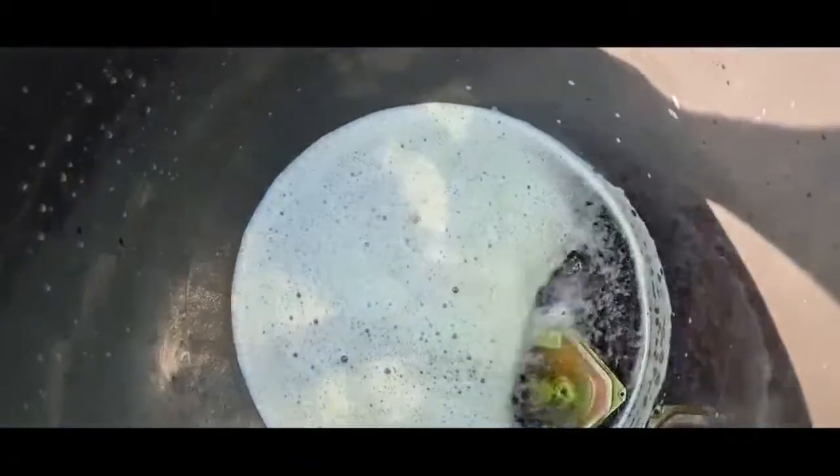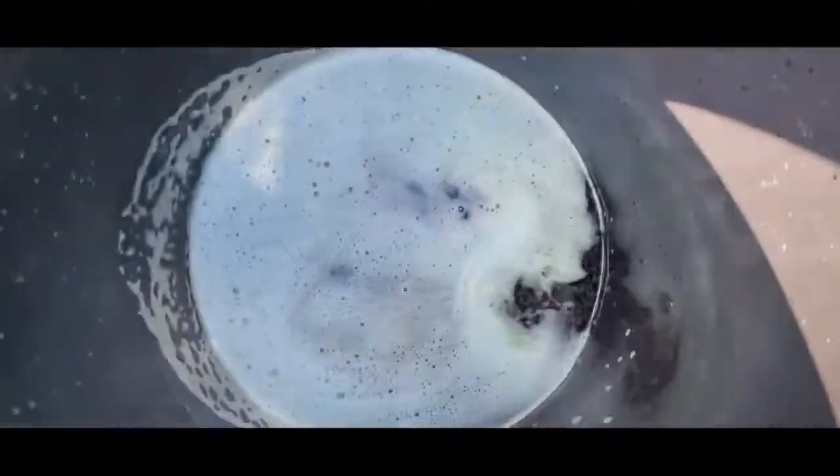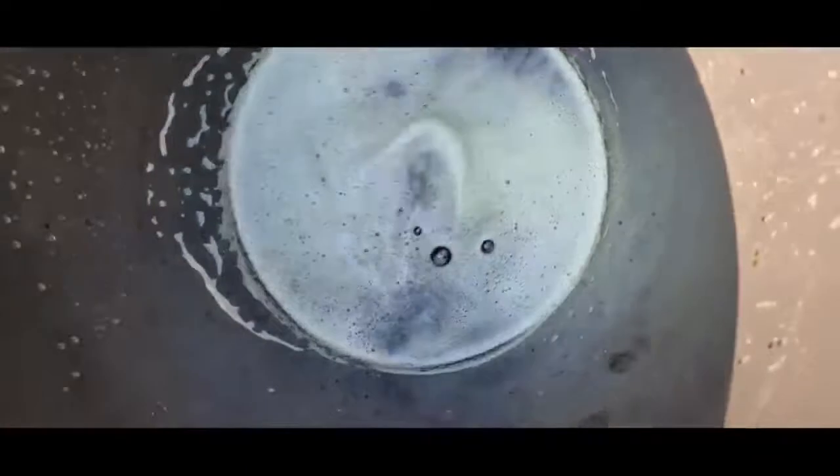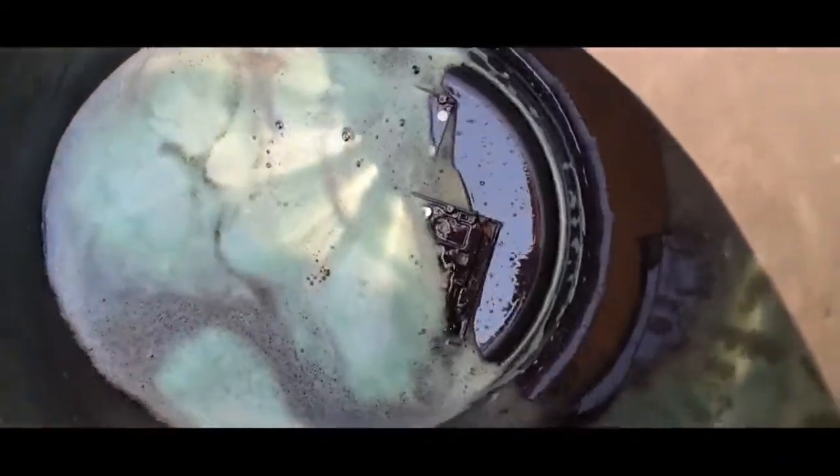About six minutes in, you can see the copper sticking. That thing I've literally just thrown in and it's copper colour already. So it shouldn't be too long, I'll leave it a couple of hours. Just one hour, ten minutes in — kind of a bit fluffy. These sheets of copper.